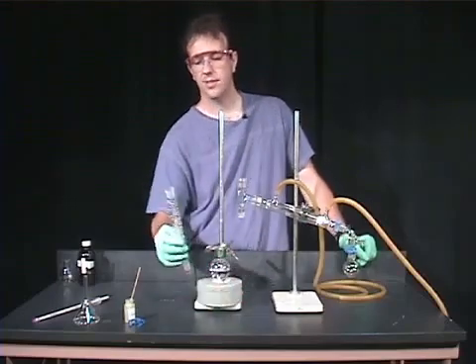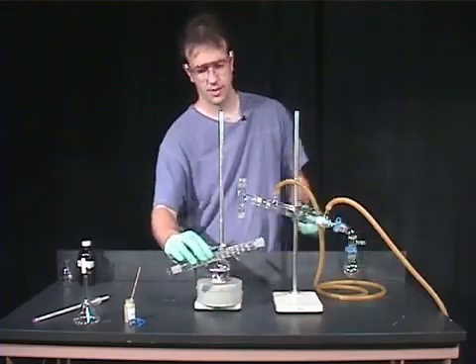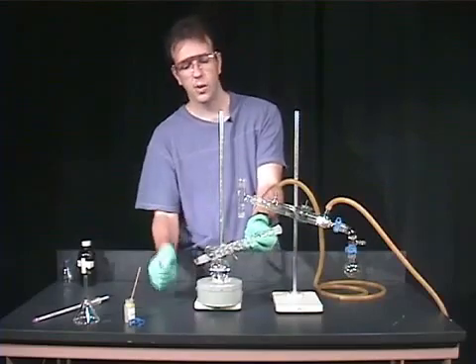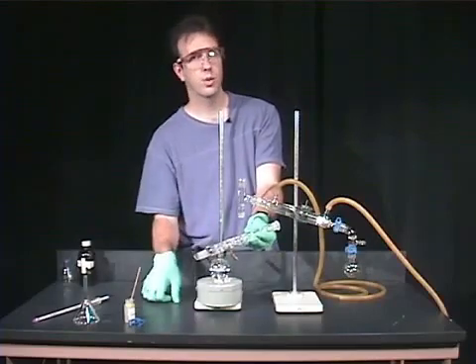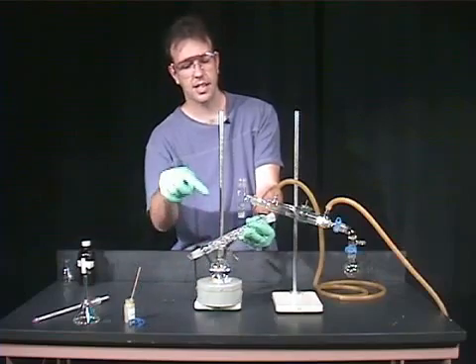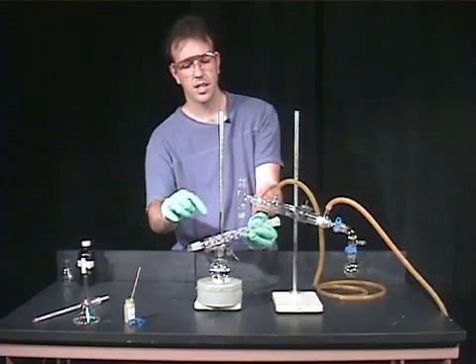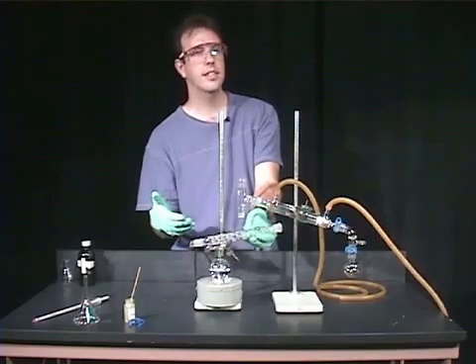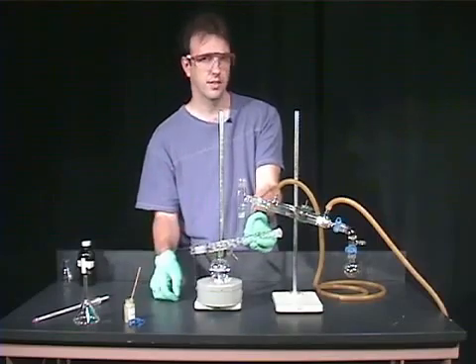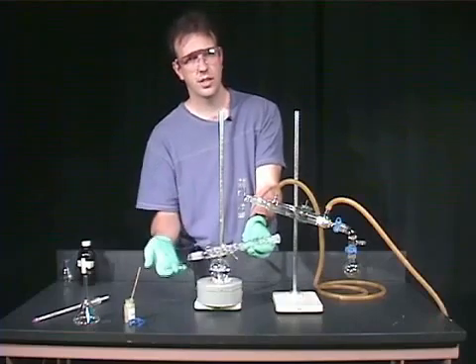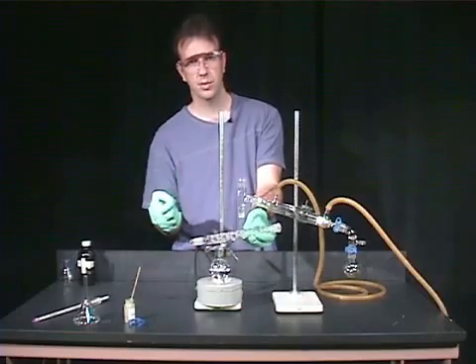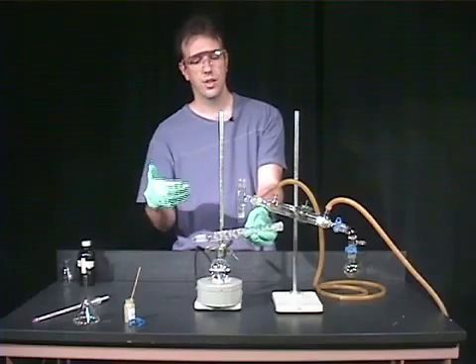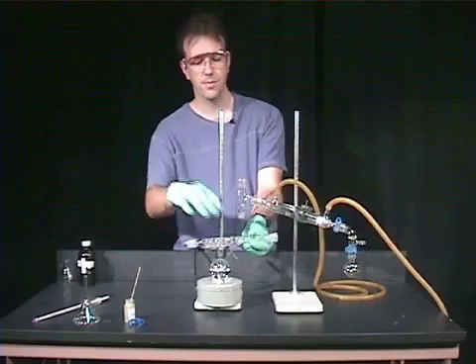And there are a variety of different columns you can use. One could be a simple air condenser where you would just have air in there. But what we're using here is what's called a Vigreux column. And this has basically little glass rods that are shooting through this air condenser. What that does is it creates more surface area. And more surface area corresponds to more liquid-to-vapor equilibriums. The more liquid-to-vapor equilibriums, the more pure the solvent or the material that you're distilling off.